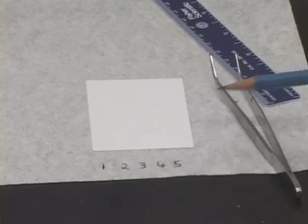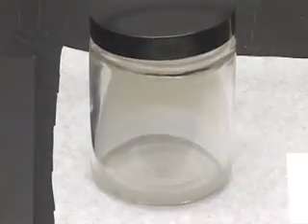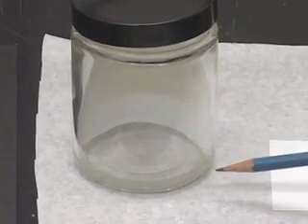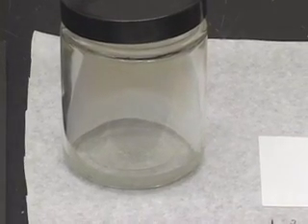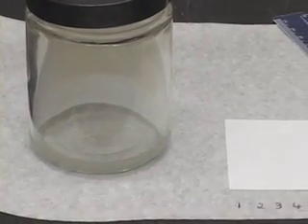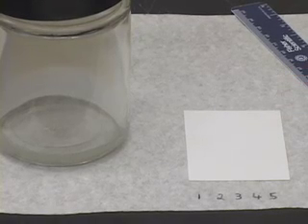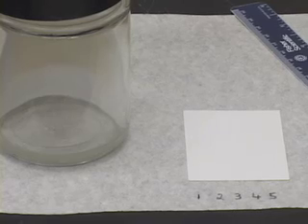So, you will take this plate, insert it in the developing jar and watch the solvent move along the plate and wait till the solvent reaches about a centimeter away from the top edge on the plate, and then take it out and mark the solvent front right away.